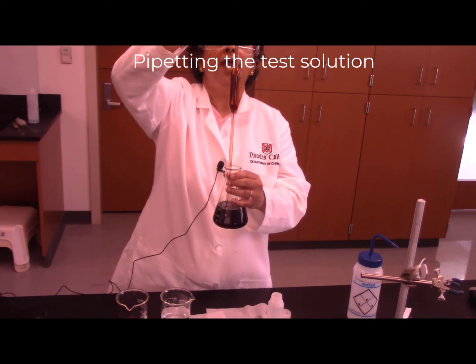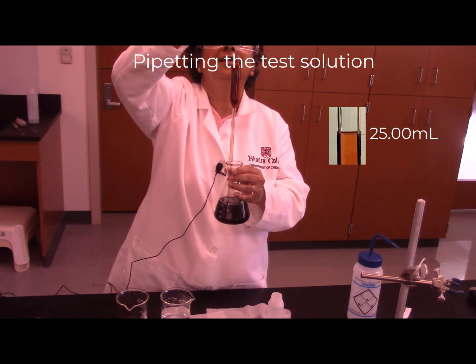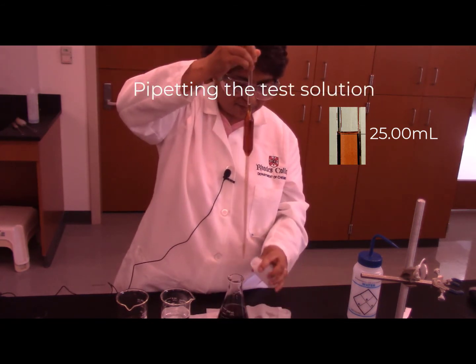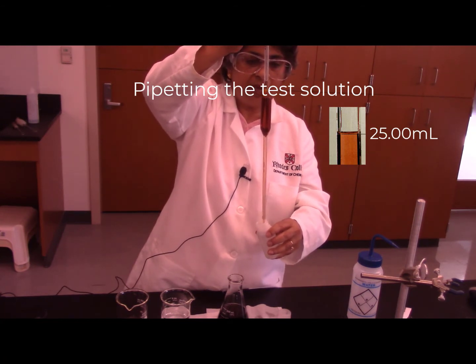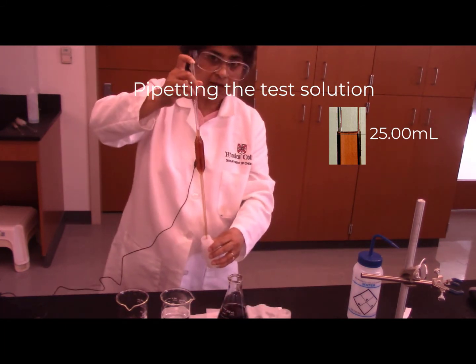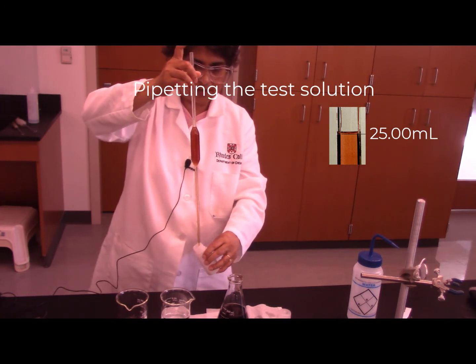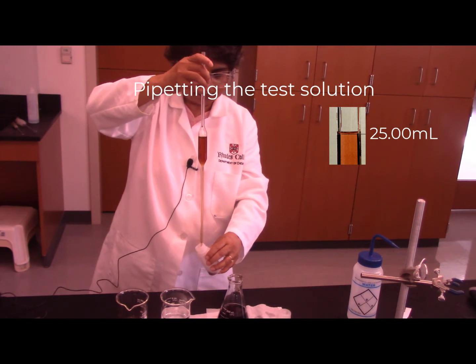Now I am going to adjust the meniscus. The bottom of the meniscus is at the 25 ml marking of the pipette. Now I am transferring the liquid into this plastic bottle. Remember to keep the pipette straight. You can tilt the bottle a little so that the liquid will drain along the side of the bottle.